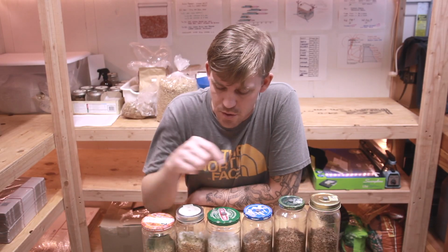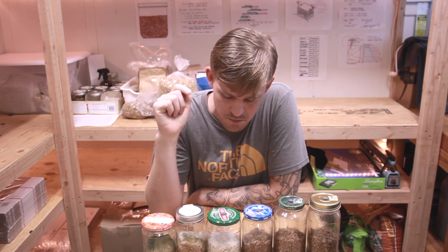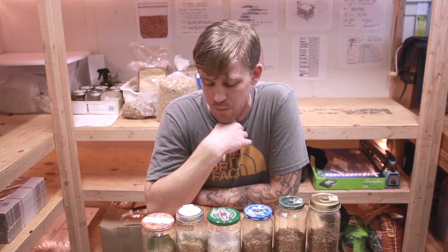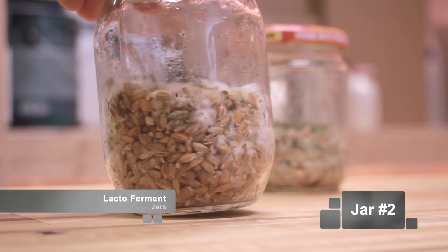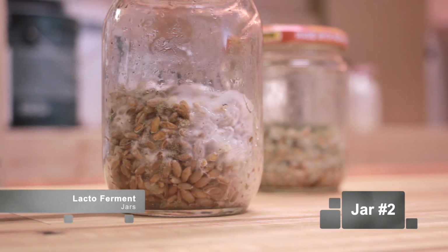So jar number 2, it actually started colonizing pretty well with the pink oyster, but again, this one also got taken over by green mold. So I think all that green mold is coming in from the drying process.